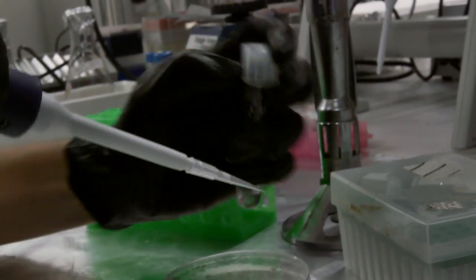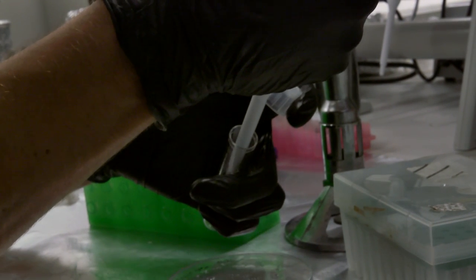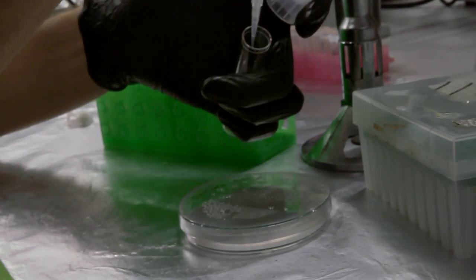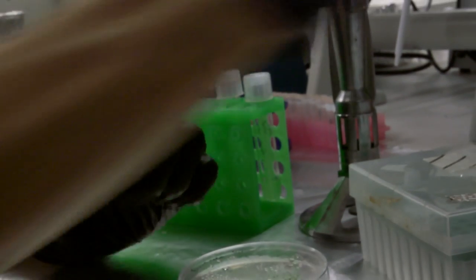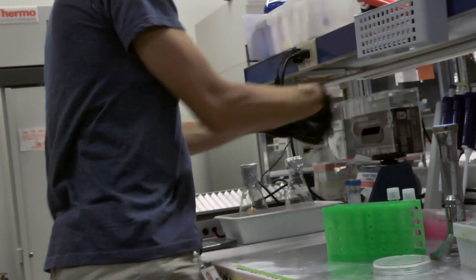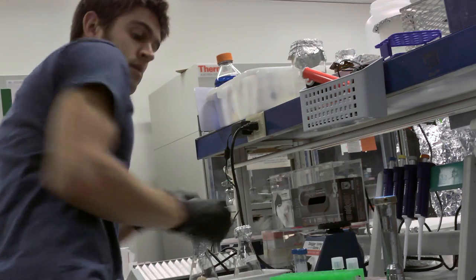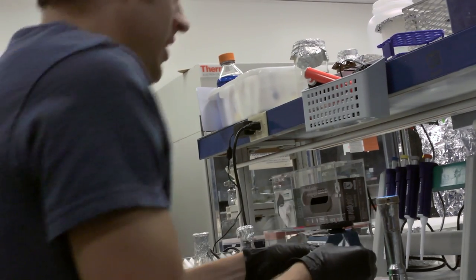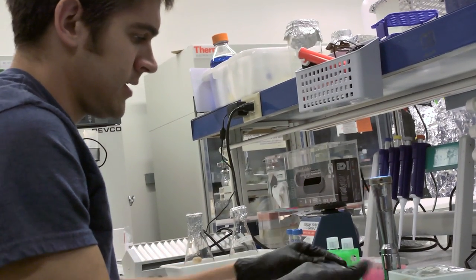Again, this is why I'm inoculating such a small culture. If the space is too big, they won't grow as well if there's too much media. So usually you start out with a smaller volume, especially with something like these algae, which are more finicky. So I'm just going to clean this area up now. I'm going to reseal this with the parafilm, which I get over here, cut some off. It doesn't take much. This stuff's really stretchy. And pull it around the plate to seal everything off.